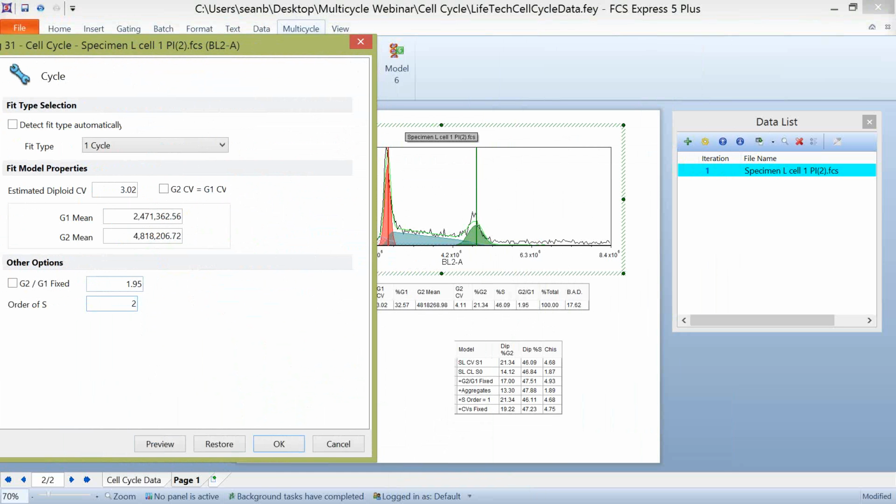And in the other extreme case here, you can use an S order of 2, which generally means that you're going to have a tilted S phase, but it's assuming that on the sides, as you're closer to G1 and G2, the S phase is a little bit higher. And with this particular data set, we don't see much difference between the order of S when we're looking at 1 or 2, but there is, of course, a great difference when we're looking at an order of S between 0 and 1 or 0 and 2.